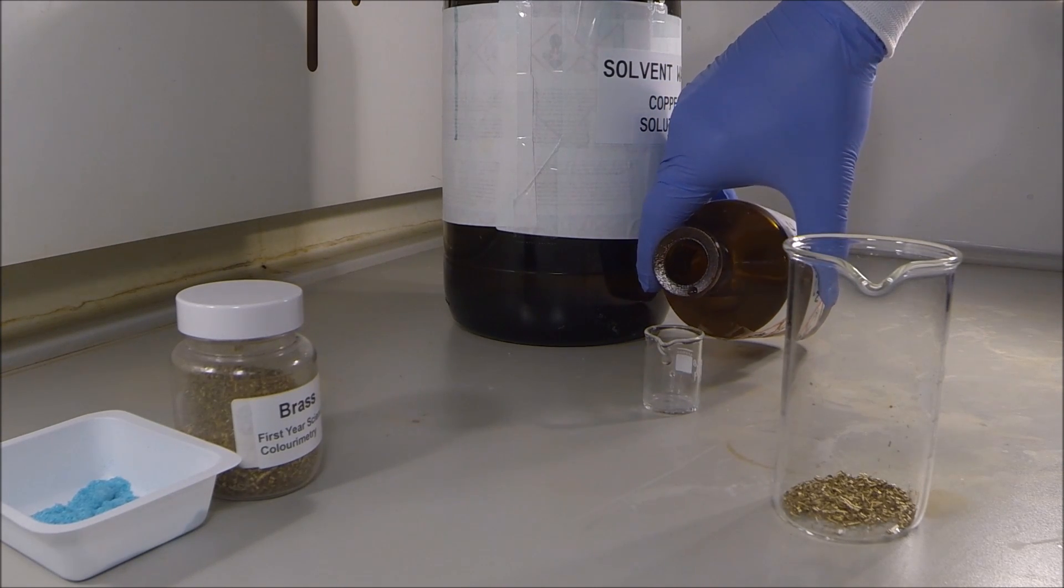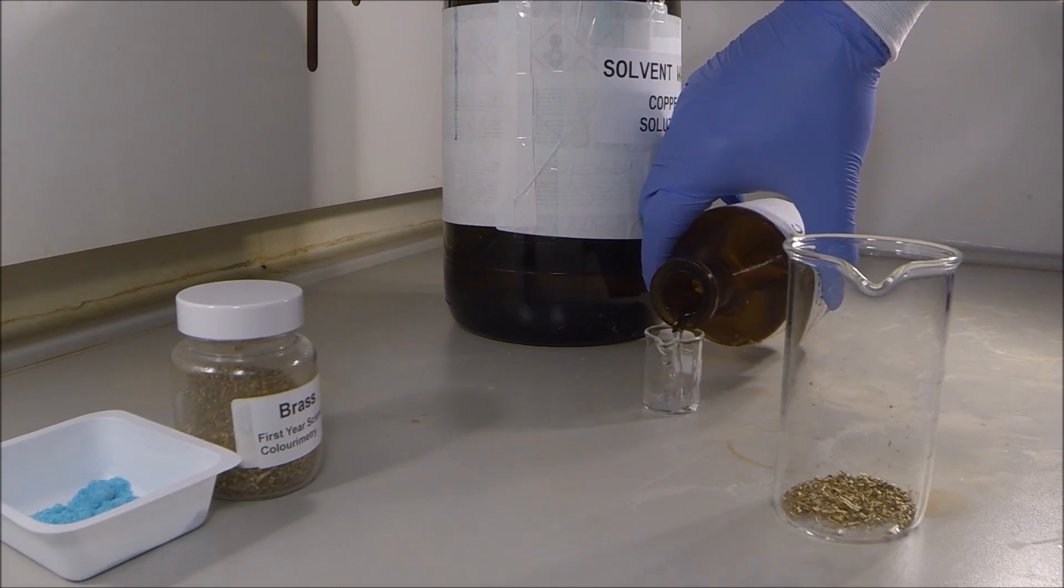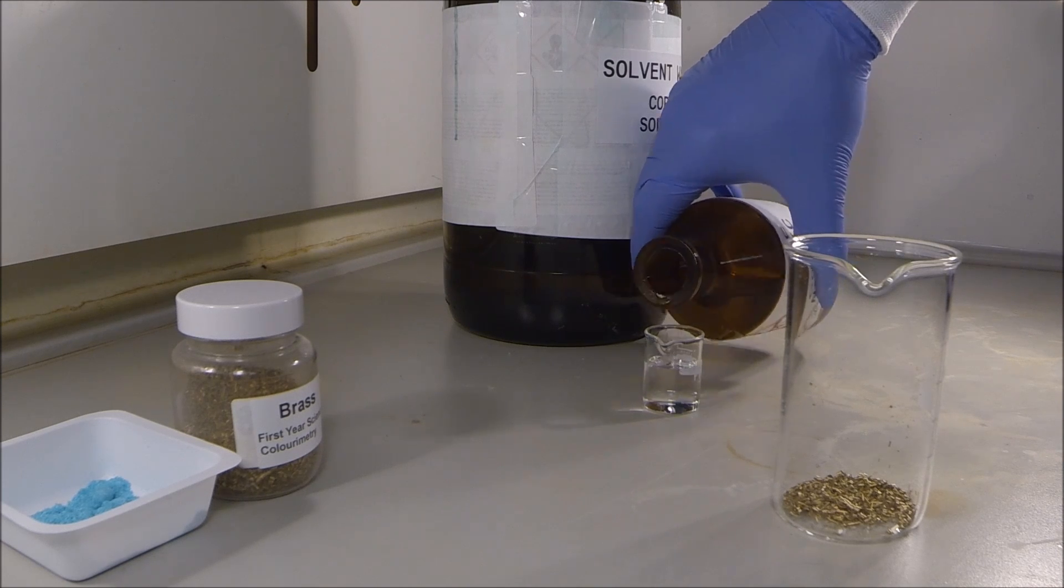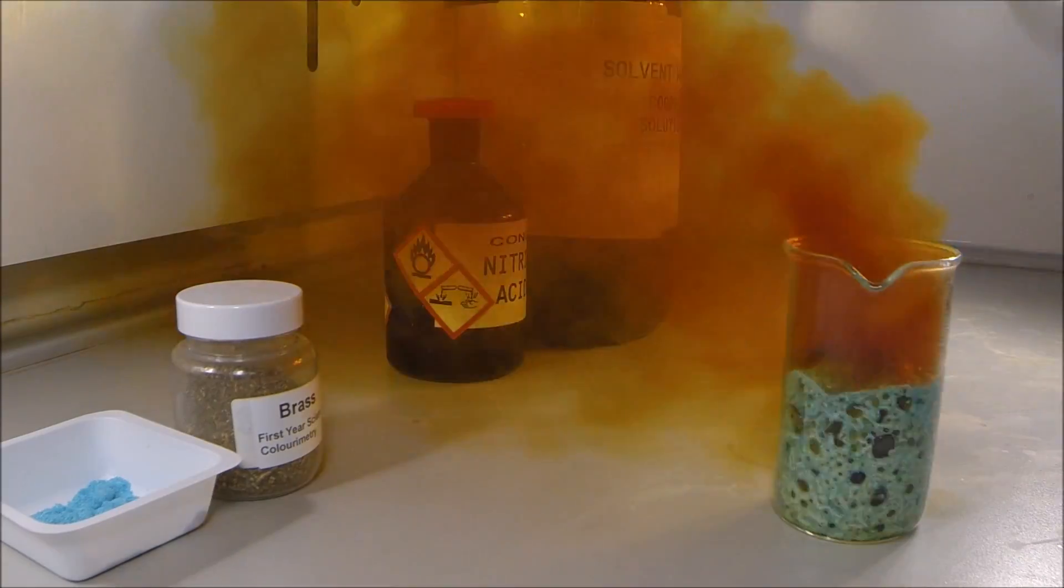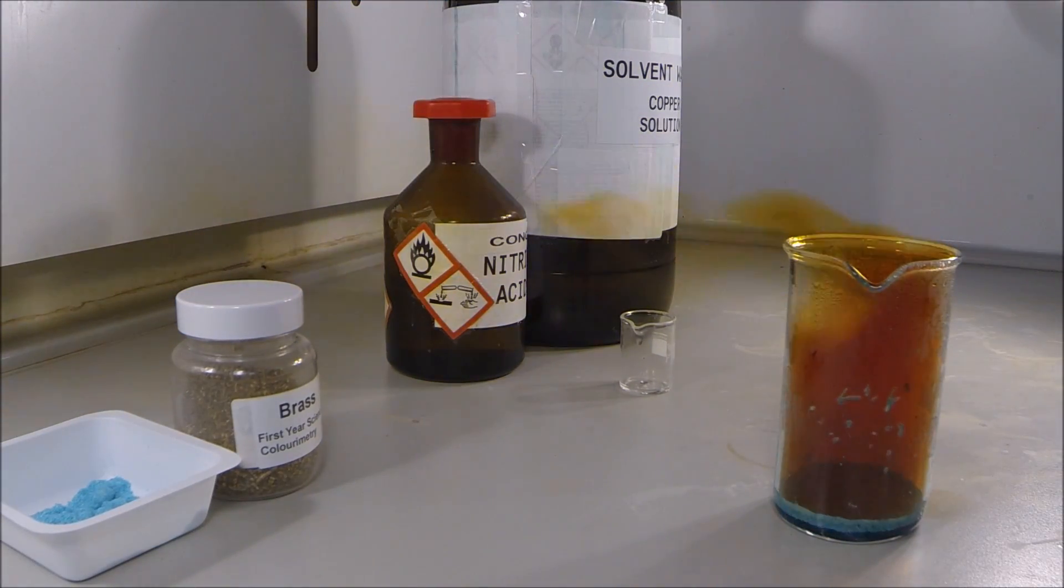You should be aware that nitric acid is highly corrosive and oxidizing, so it's important to have lab goggles, gloves and a lab coat on at all times, and to carry this reaction out inside the fume hood.